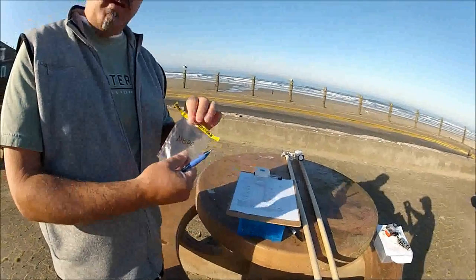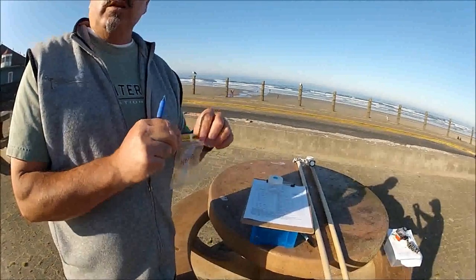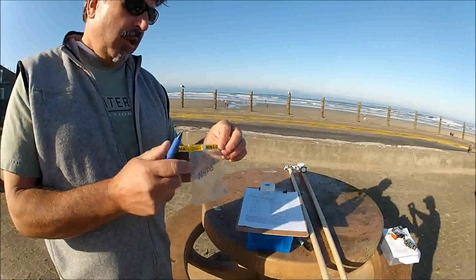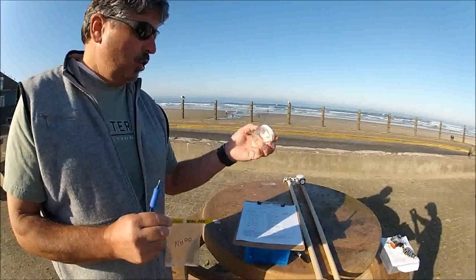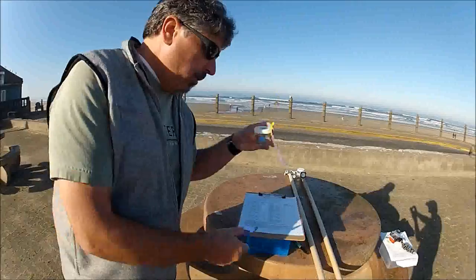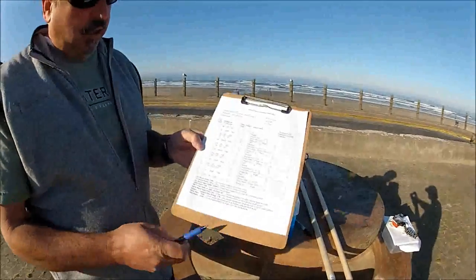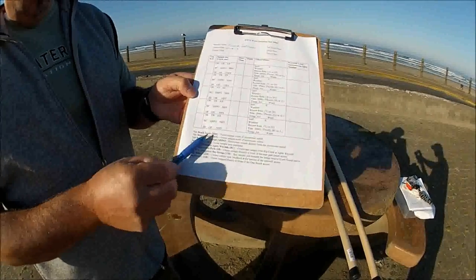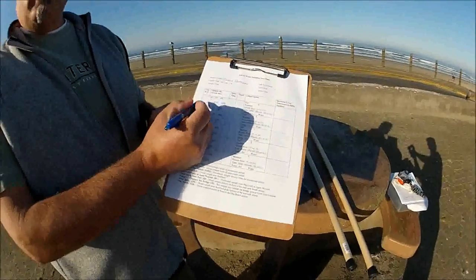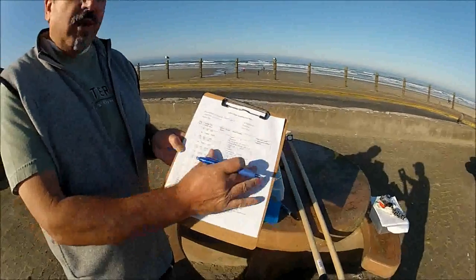When you fill these bags, don't fill all the way to the top — do it about halfway. Leave a little air in there so there's oxygen for the microorganisms. We have both the jar with a label and the bag. On the data sheets there's a description of the locations and what the initials mean. Log each sample separately — one row per sample.